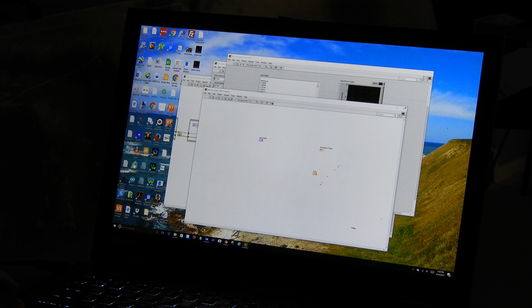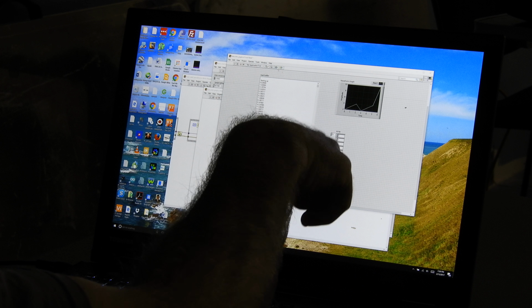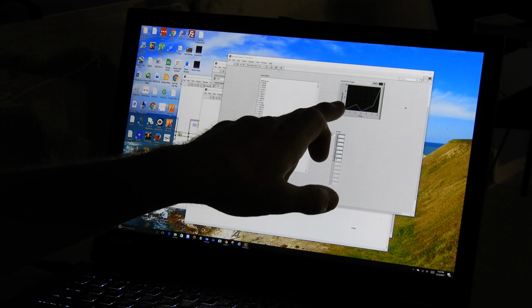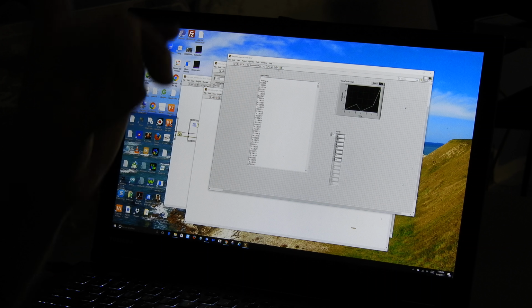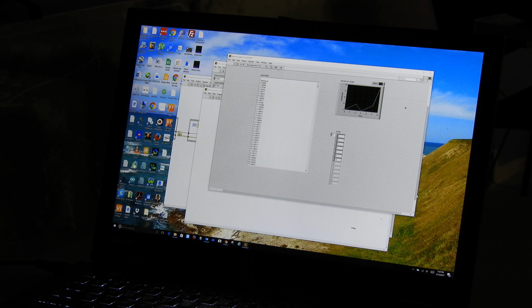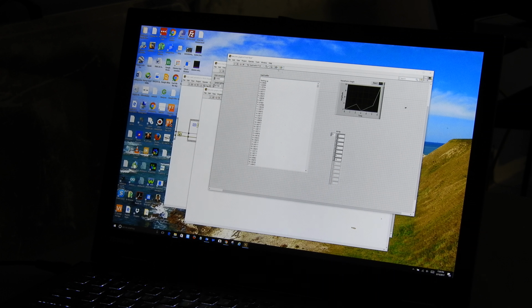Now that I've created this, I'm going to take this array and put it to where its values feed the waveform graph. When I do that, watch what happens. Boom, there's the graph of what it is that I was trying to create. So I knew by right-clicking on this and saying create constant that it would accept a 1D array of floating point values. It is polymorphic, meaning it can accept more than one type of input, but I knew by doing that create constant thing that it would graph it. So I just fed it exactly what it wanted, and now here I've got a graph.